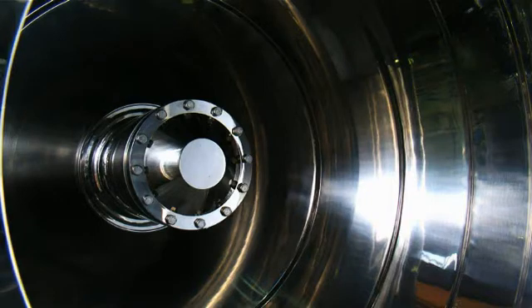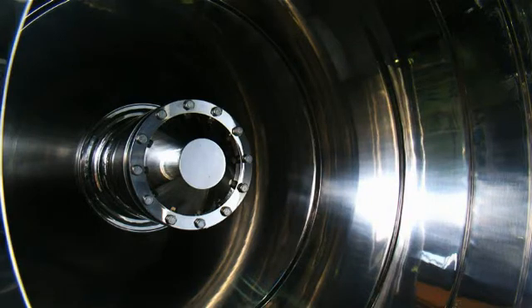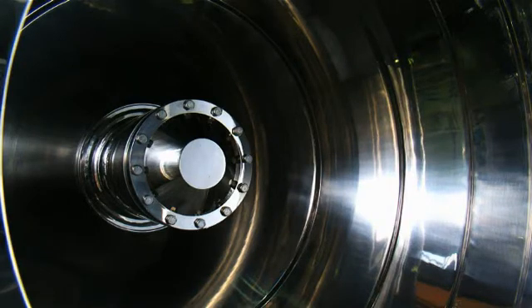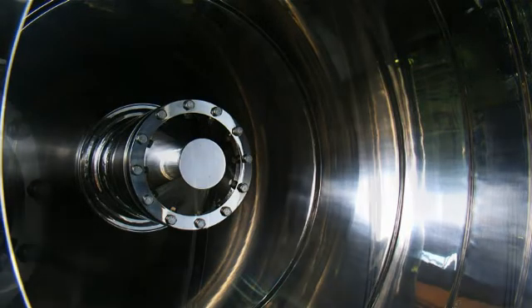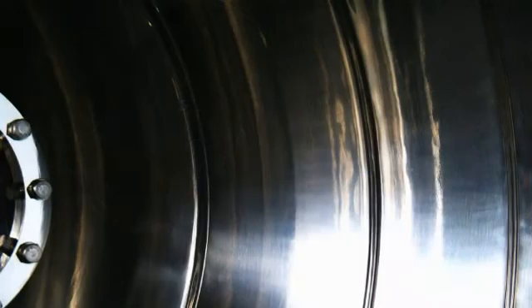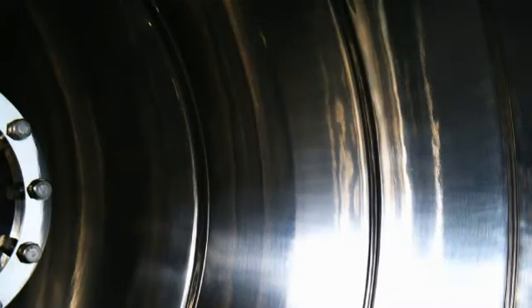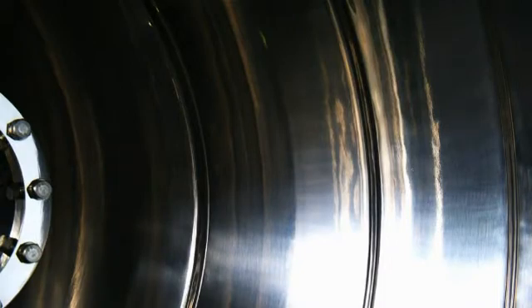The heating surface plates are spin drawn from thin stainless steel plates, adding differences in level to the plates. This process boosts the product's pressure resistance and enhances heat transfer.